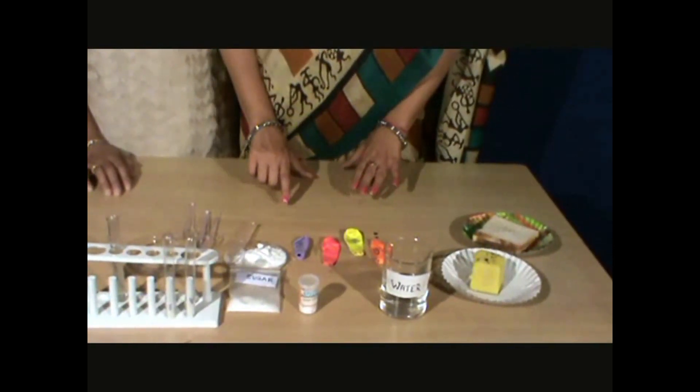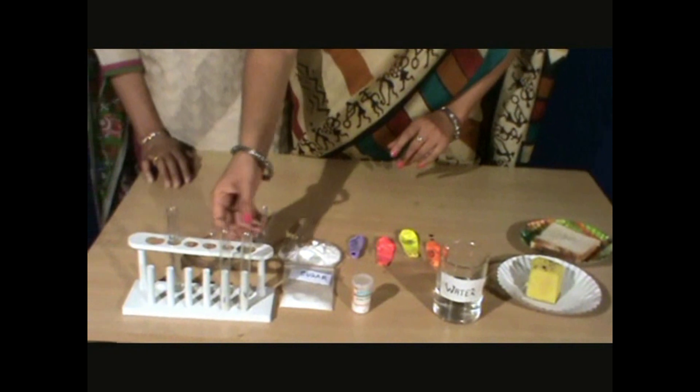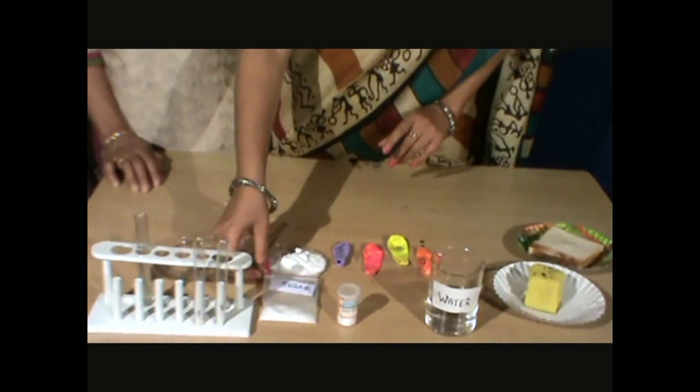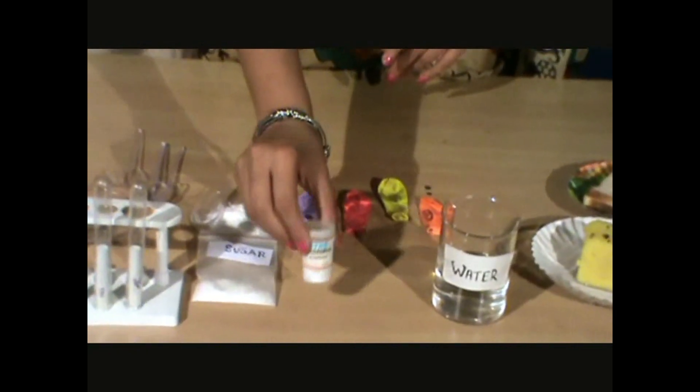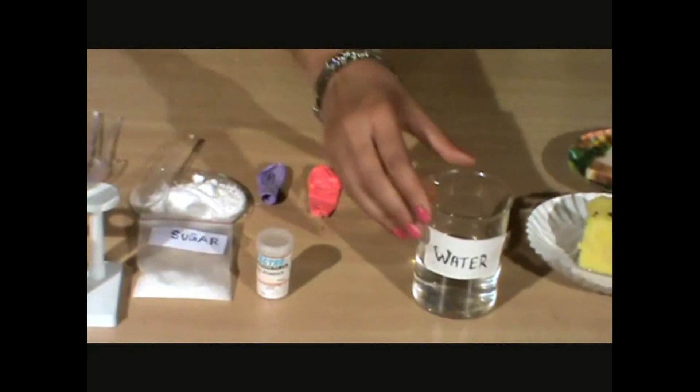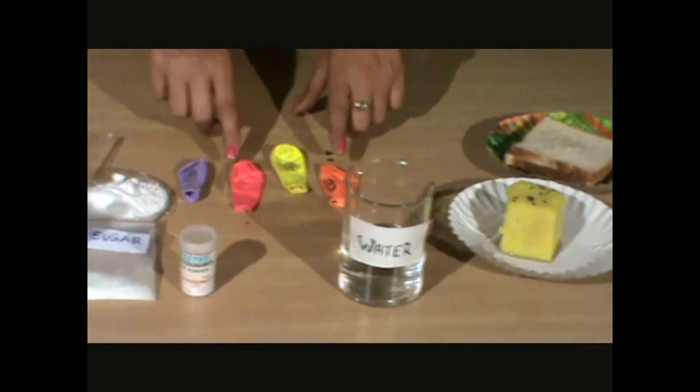For this activity we need test tubes, sugar, yeast powder, water, and balloons.